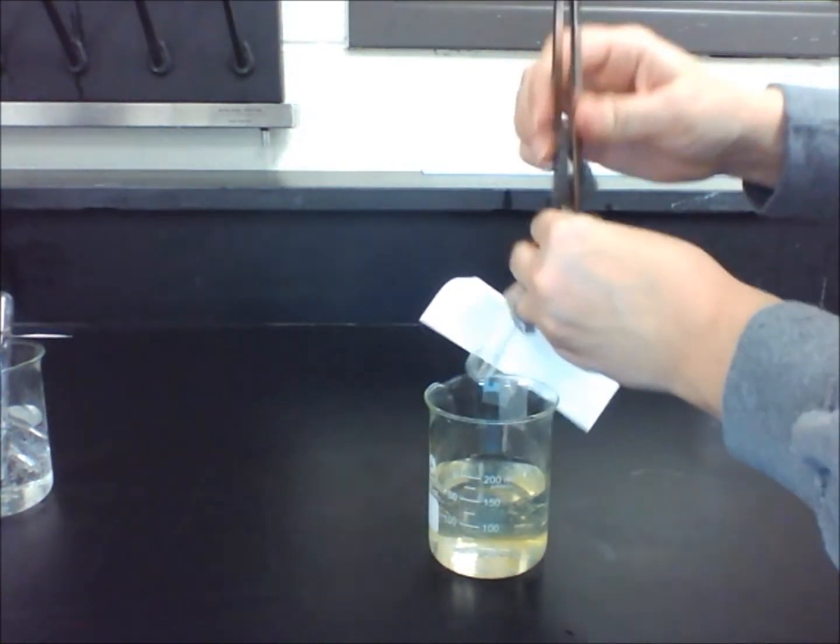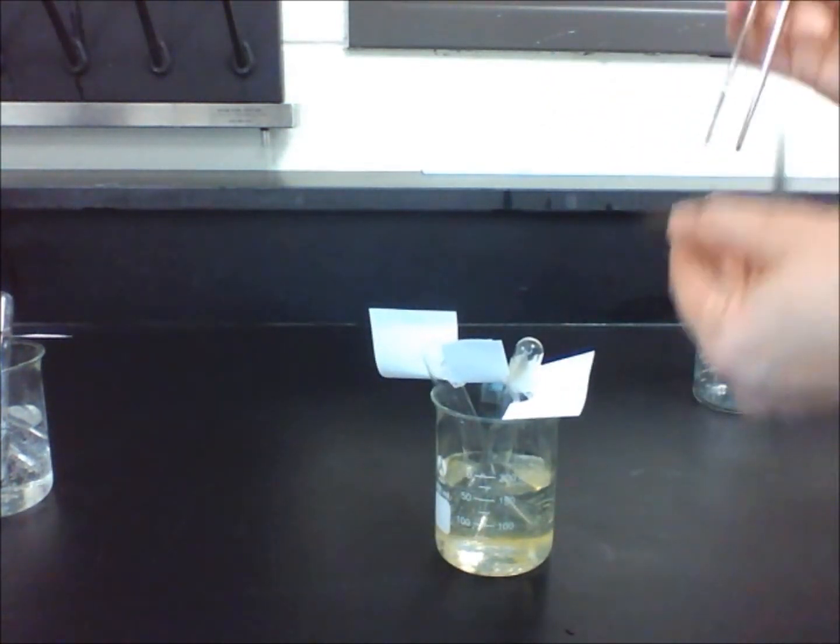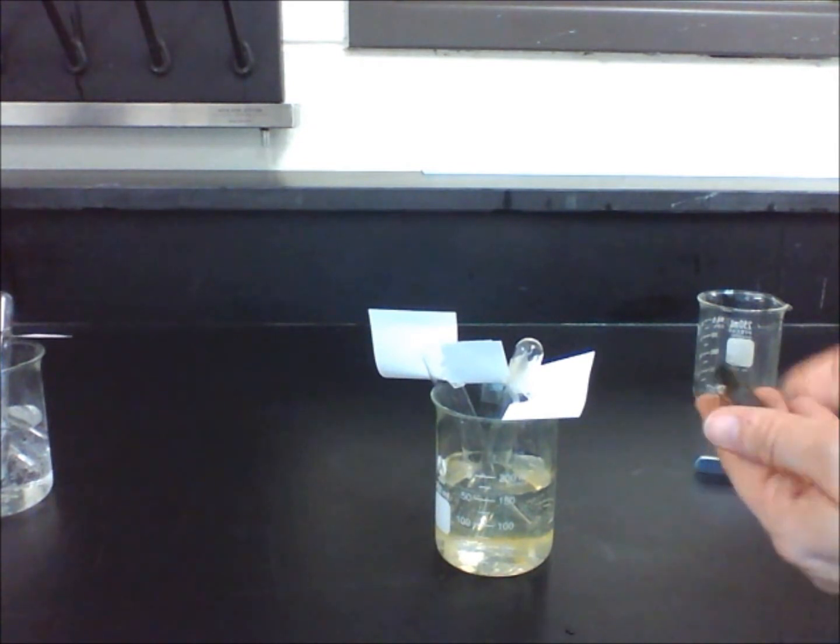We used two test tubes in this experiment because the empty tube was a control. We used this to see how the water level should be without the reaction taking place.